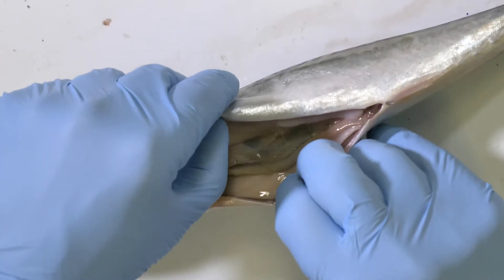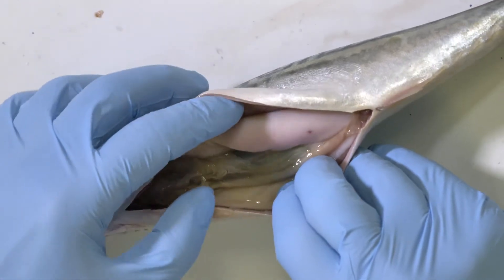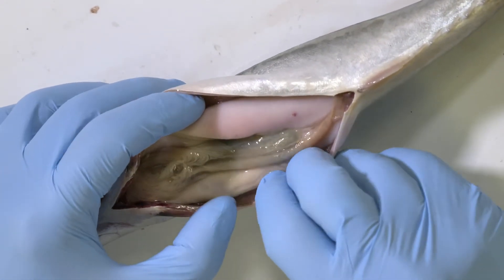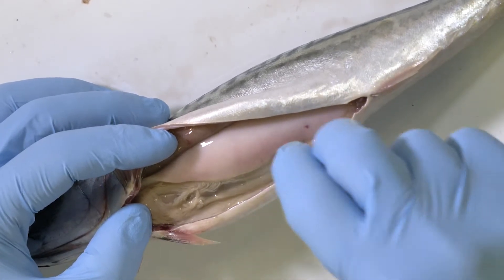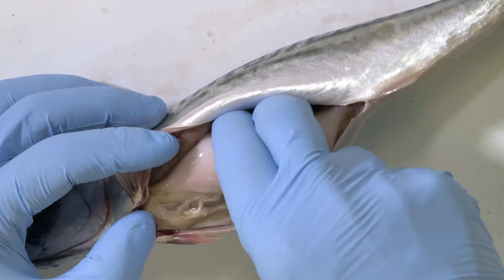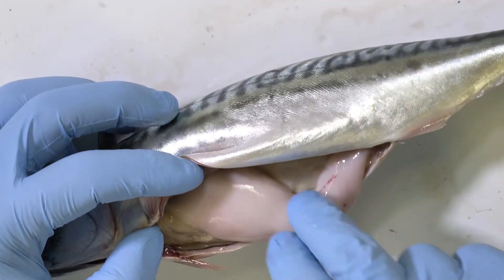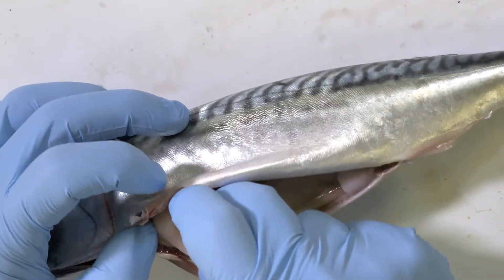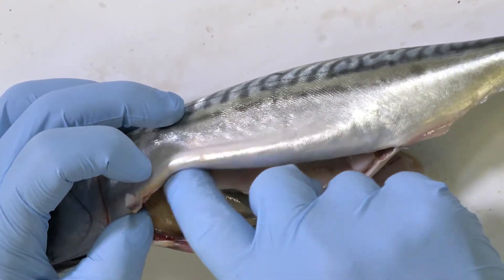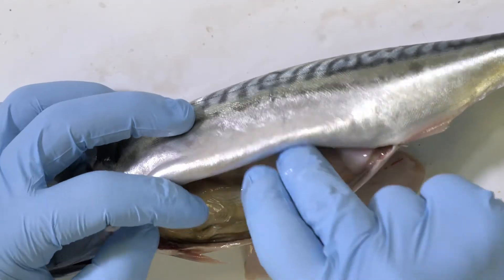Using your hands you can spread the incision apart. The most prominent organs that you will find in fish — although this depends partly on the season when the fish have been caught — are the gonads. Here you can see these milky white structures which are very prominent. These are the male gonads of the fish and they're very fragile. They can easily be pulled out of the body cavity and set on one side.